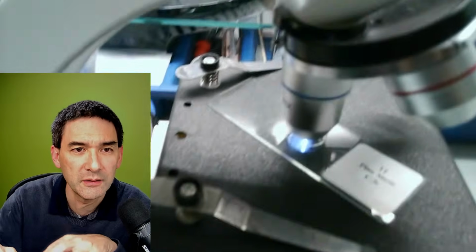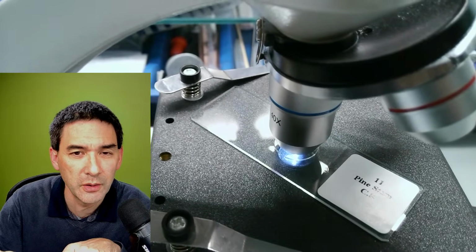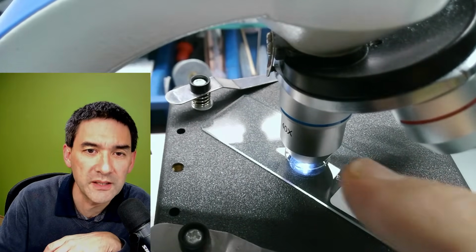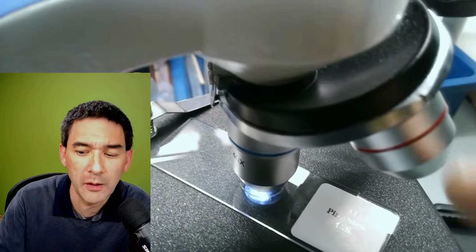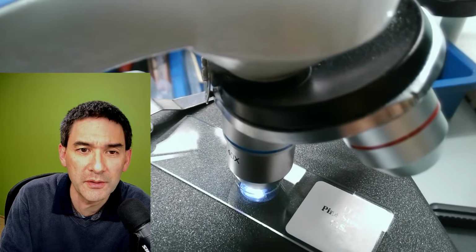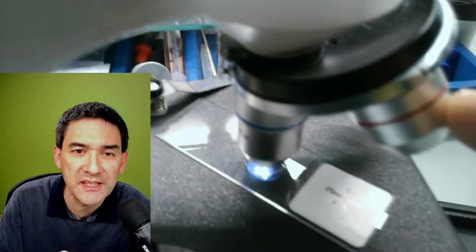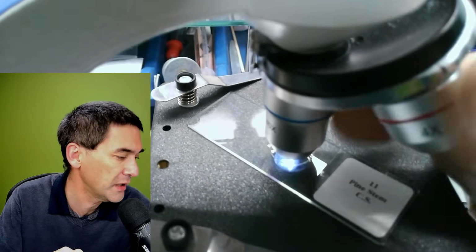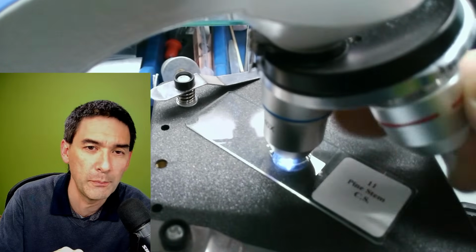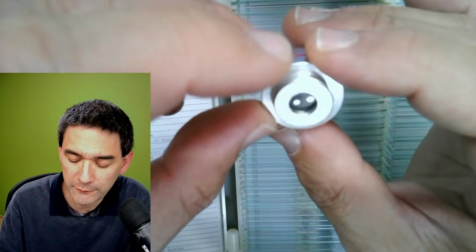So that's the microscope here. Here we go. And these are not standard optics. They are actually quite a bit smaller. However, there are also small microscopes like this that have slightly larger optics, and sometimes you don't actually see this very well from the pictures. But you know what I'm going to do? I'm just going to take this one out, so that you can have a little comparison. Here, look, it's actually fairly small, but it's made fully of aluminum.